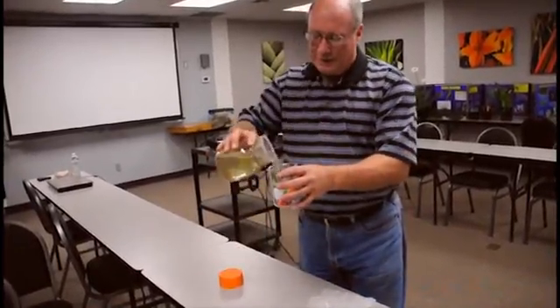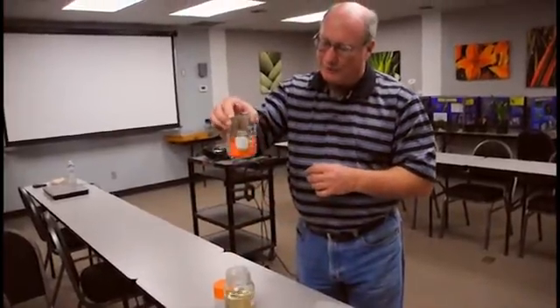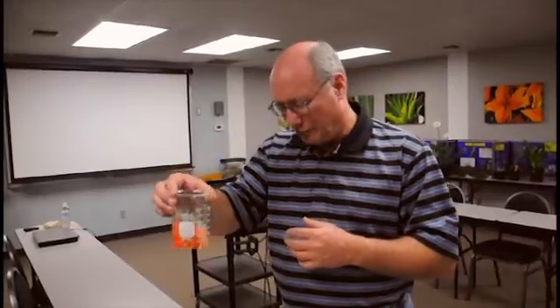So I'm going to put that in there and pour the alcohol in so that it's covering the samples and swirl it around, swish it around a little bit. You can let it sit for 30 seconds or so. That usually helps the thrips and things to want to get off that plant. They feel the alcohol and it's going to encourage them to get off of the sample.